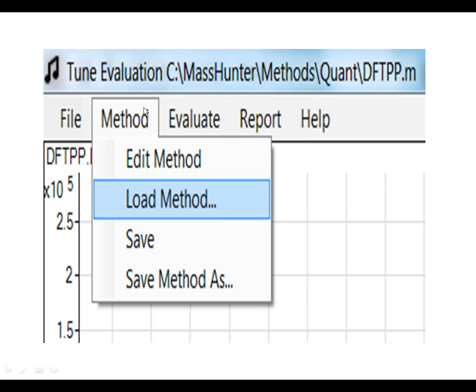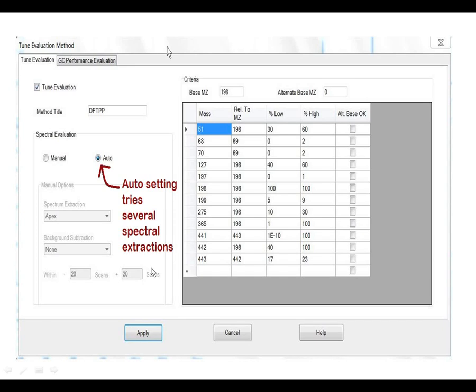You have a method. You can edit that method. You can load that method, save the method. So for the tune evaluation, you have the ability to define criteria that it must meet in order to pass by picking an ion and then some ratios associated with a related ion. You can also pick an alternative base ion to get those percentages.